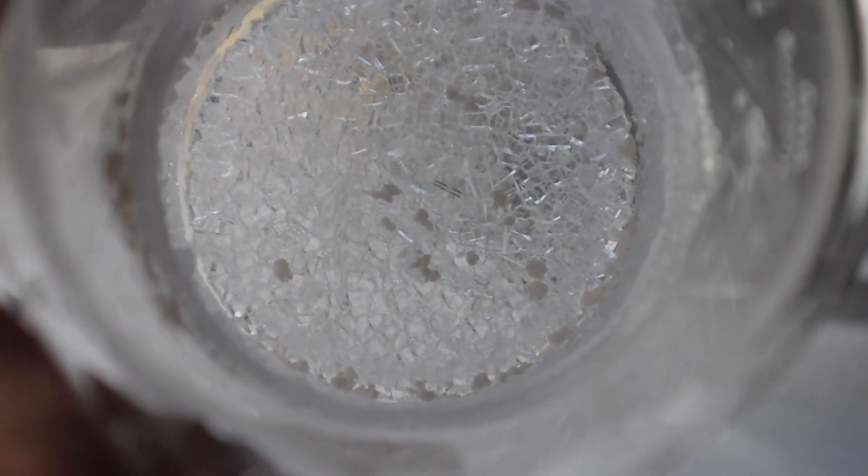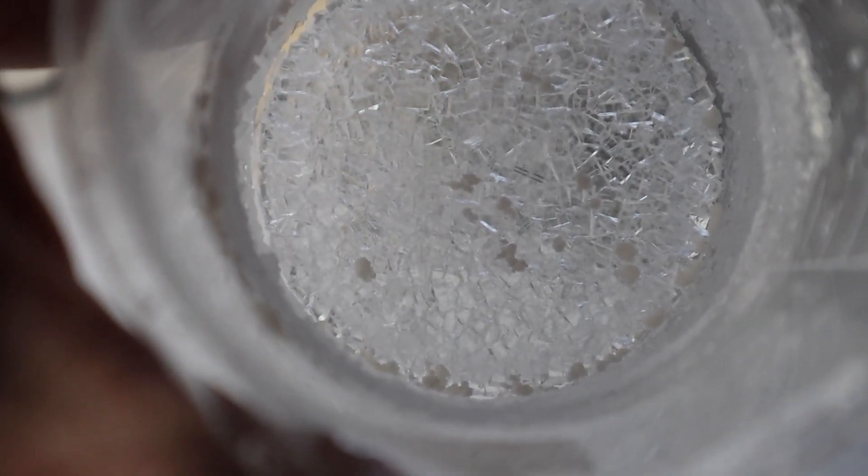It is not completely dry yet but it's pretty close, and I think it's pretty cool to see these crystals on the bottom of the beaker.